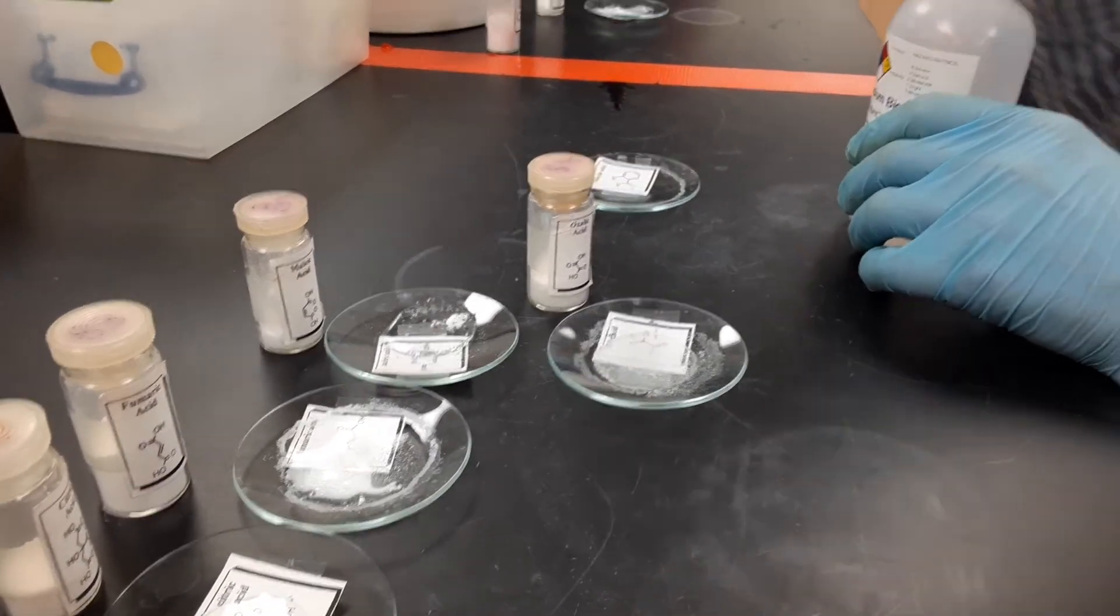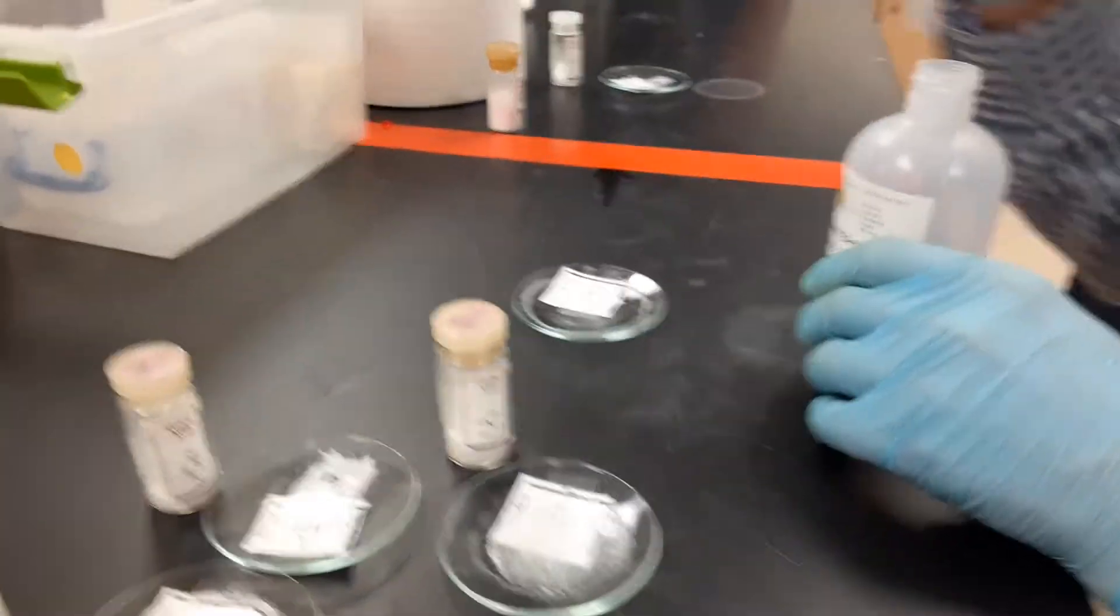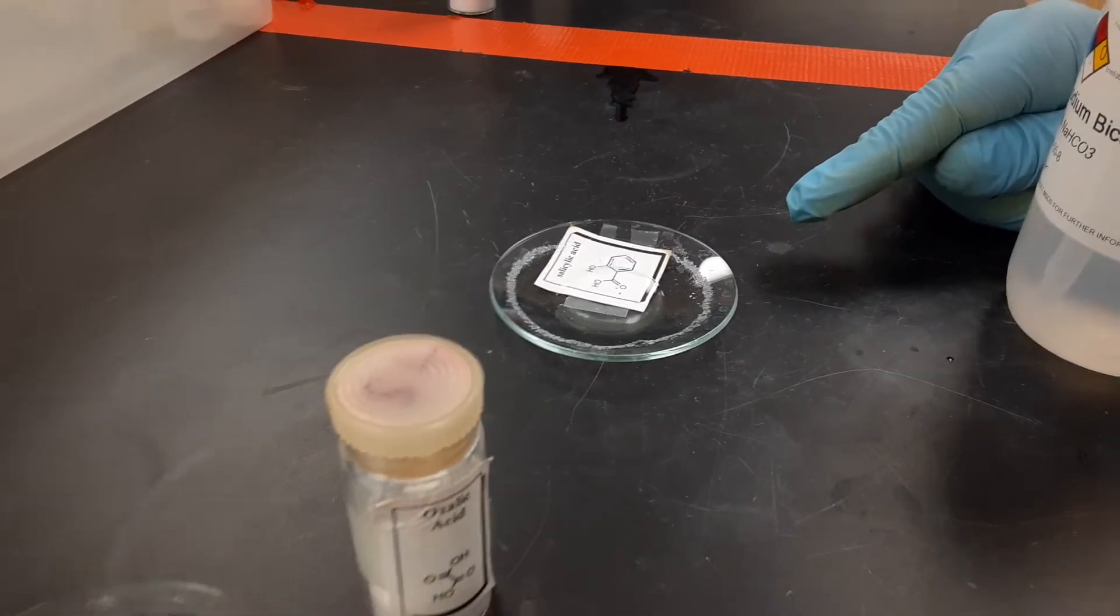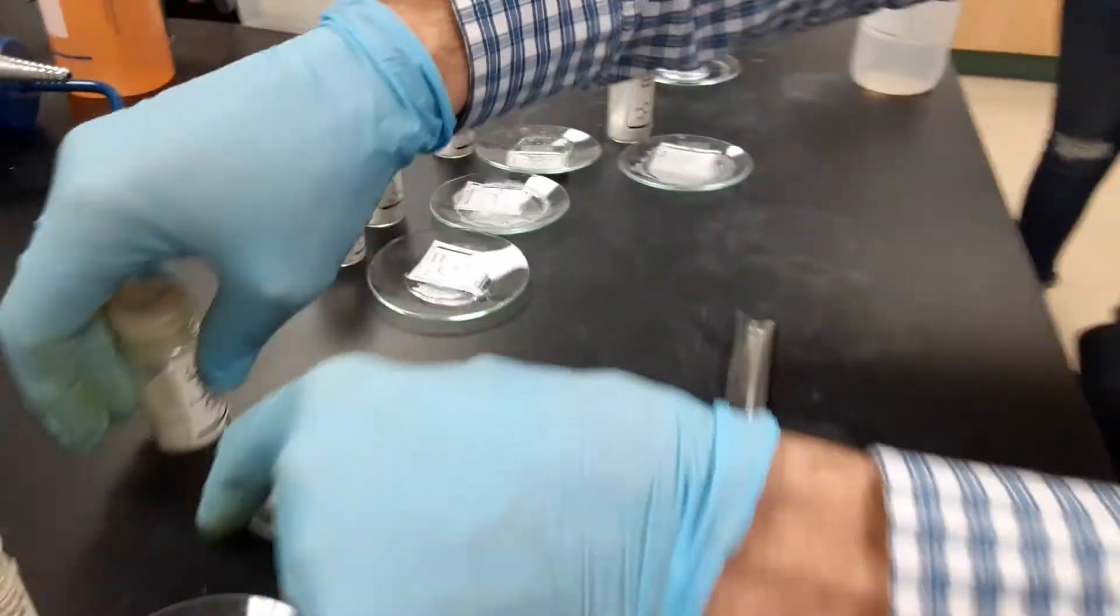Salicylic - oh I spilled a little bit. It's a slow one. I put that like just a hair better than this one.